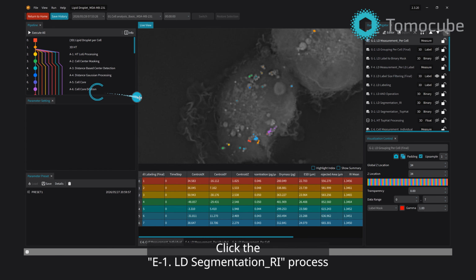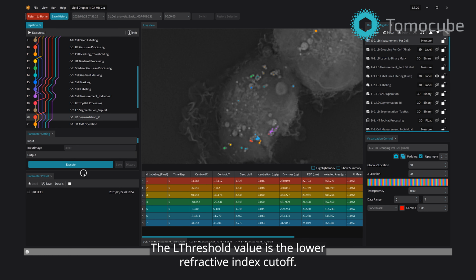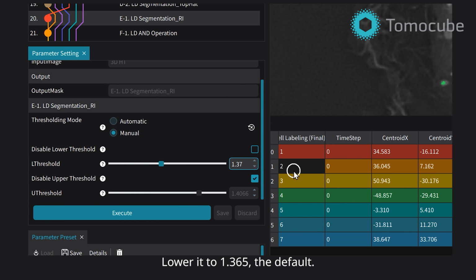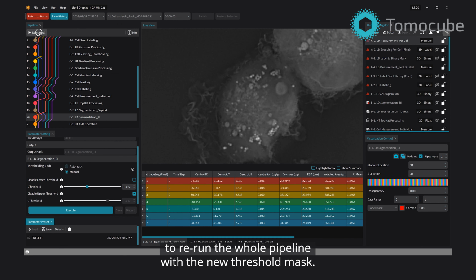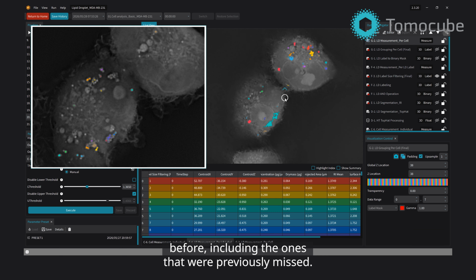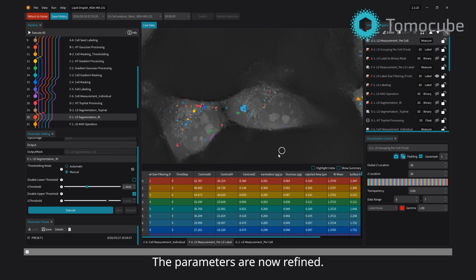Click the E-1.LD segmentation_RI process to see its parameters. The L threshold value is the lower refractive index cutoff. Let's say the current value is 1.37, relatively strict. Lower it to 1.365, the default. Now click Execute. And then click Execute All to rerun the whole pipeline with the new threshold mask. When the pipeline finishes, check the live view. You should see more lipid droplets detected than before, including the ones that were previously missed. The parameters are now refined.